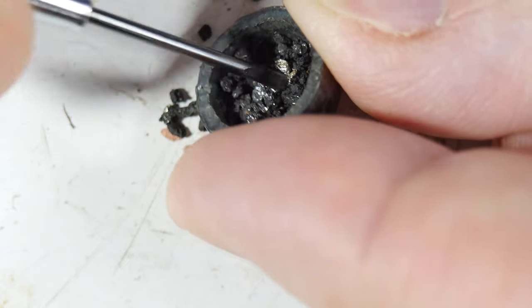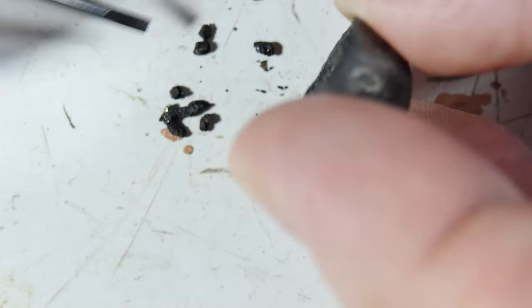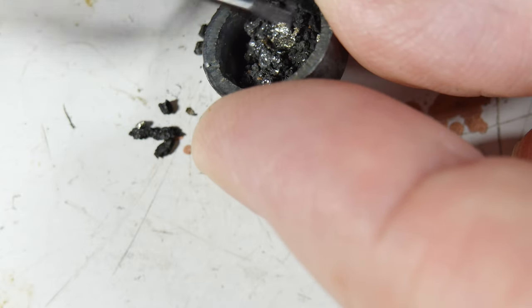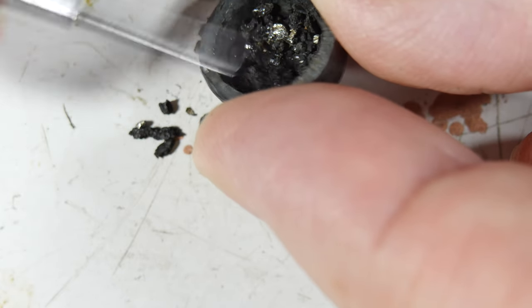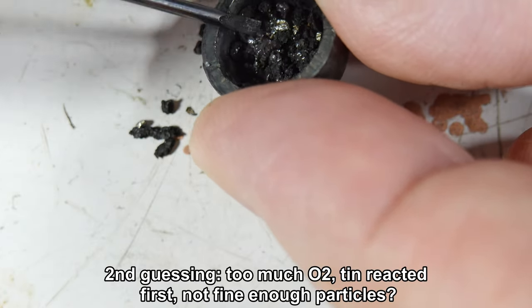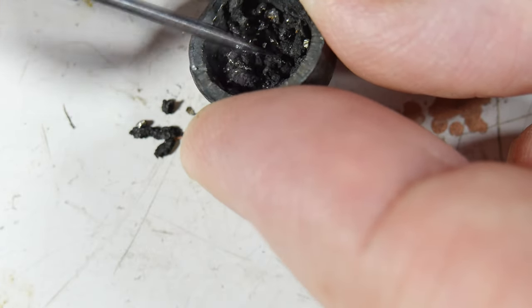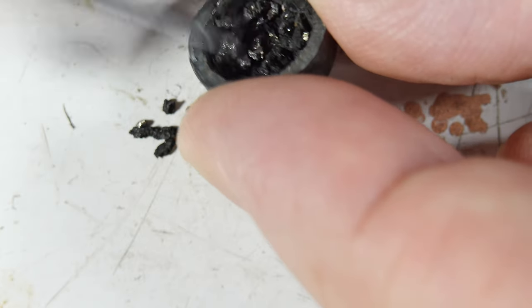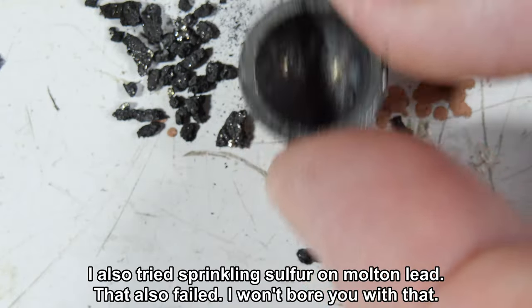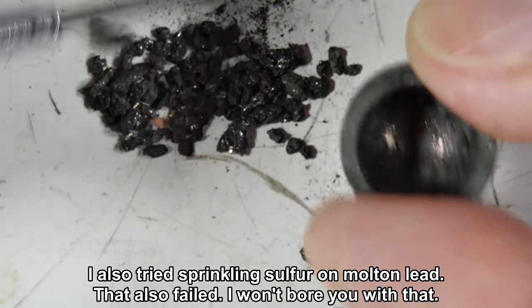So it looks like this was a fail. Yeah, the lead and the sulfur did not fully integrate. The temperature did not get high enough long enough. That was a failed experiment in trying to make my own galena.